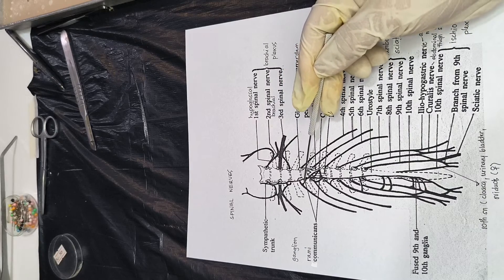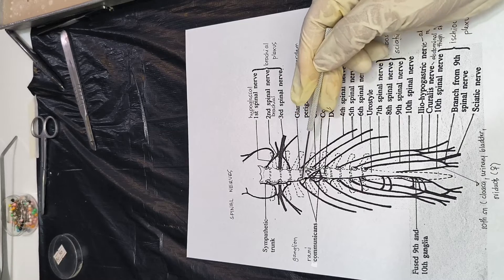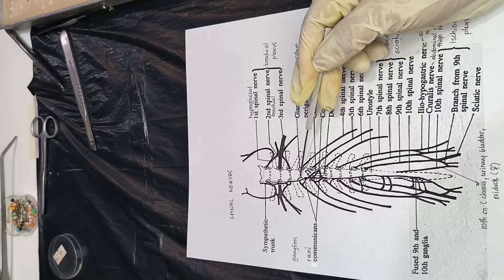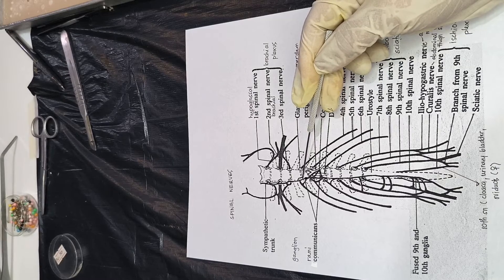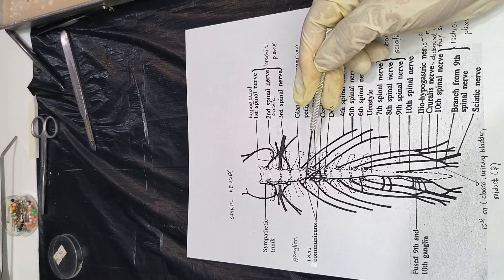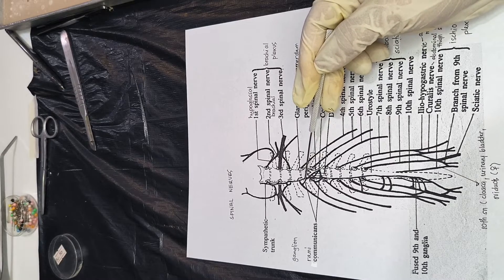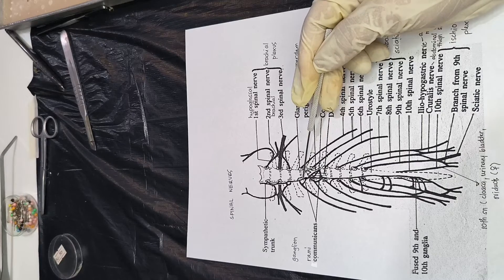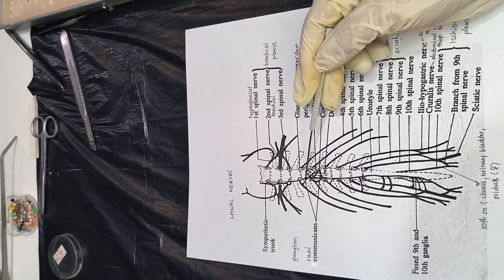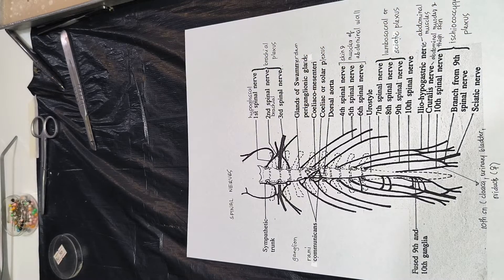The ramus communicans connects the spinal nerve to the sympathetic trunk. The ganglion is located at the union of the ramus communicans and the sympathetic trunk — that's where you see the ganglion. Now, for the more exciting part, we are going to see the actual frog.